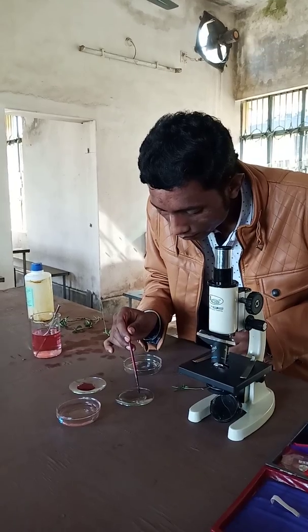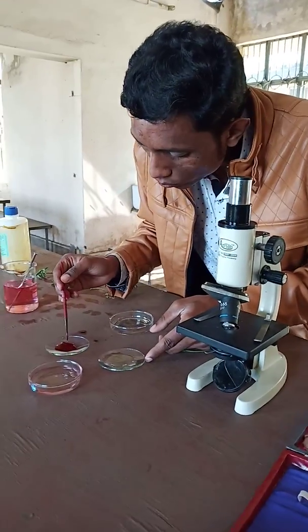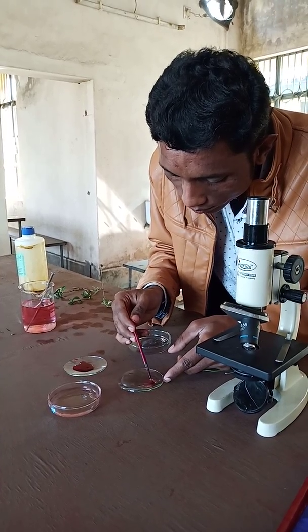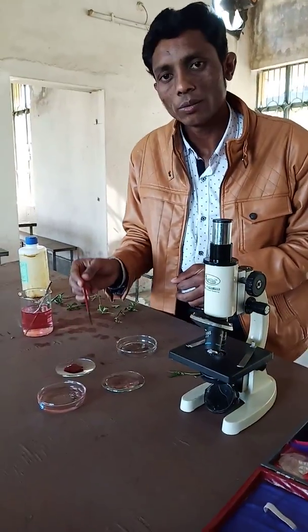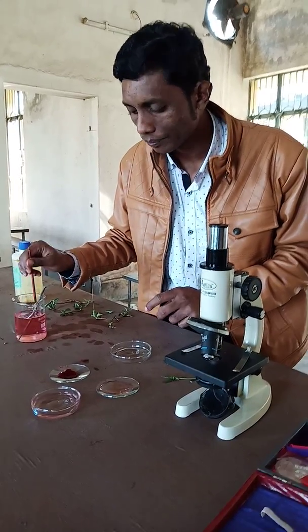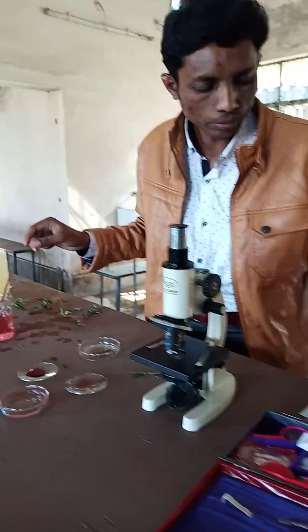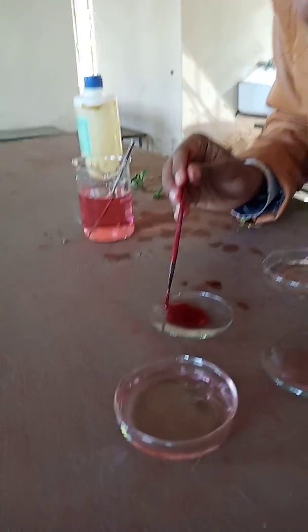After some time, the sections will be transferred to the safranin stain. Here in this watch glass which contains safranin, we have put the specimen — that is the TS of the stem of Tridax. After waiting two to three minutes, we will take out the TS.